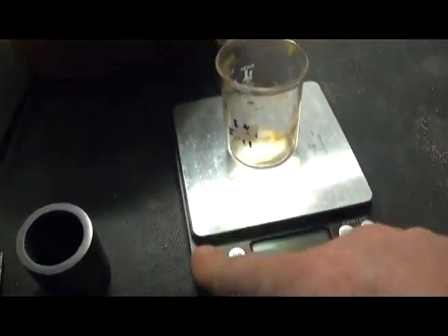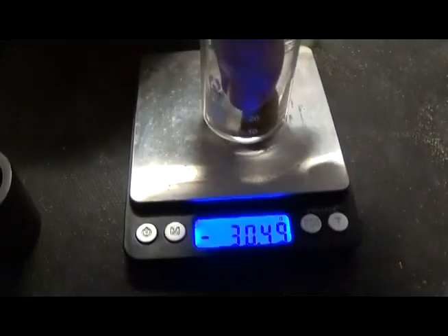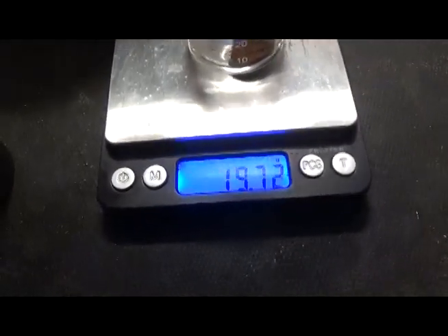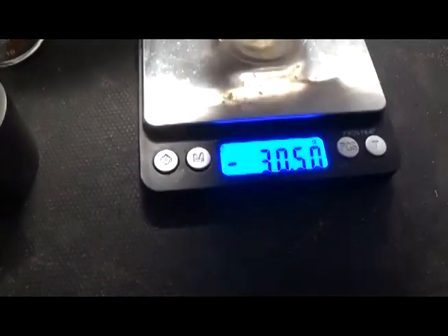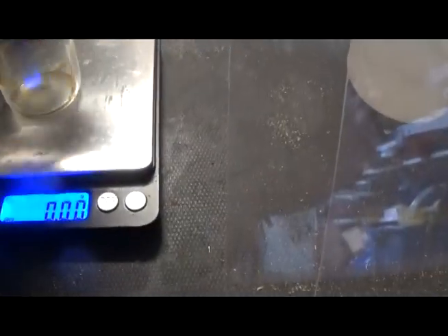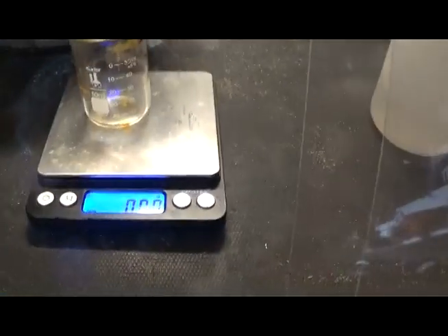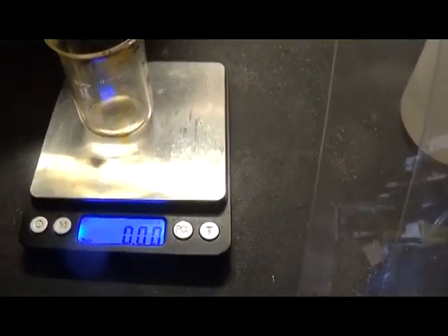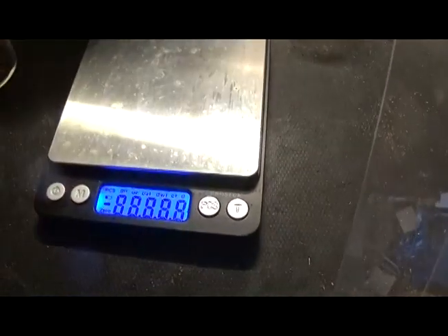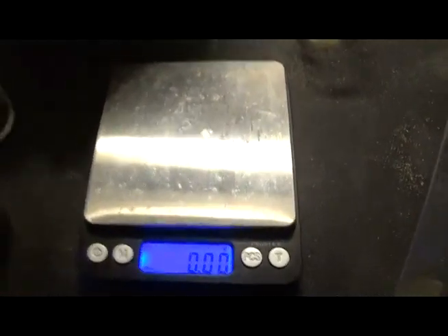All right, we're going to just weigh the powder. Go ahead and tare this out with a small little beaker there. Okay, I don't think it worked there quite right. Let's do this one more time. Is that two different size beakers? I think that's two different size beakers. Yeah, I think we've lost our minds here. All right, man, that's some good looking powder there.